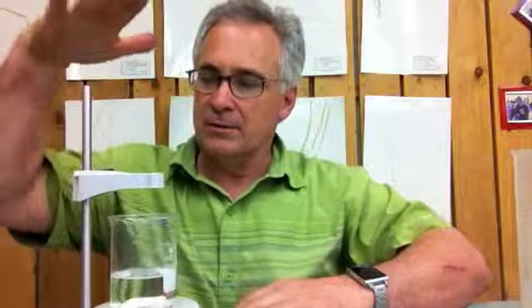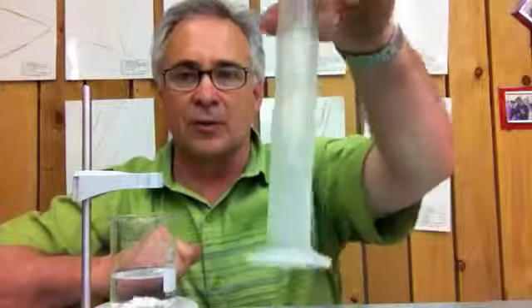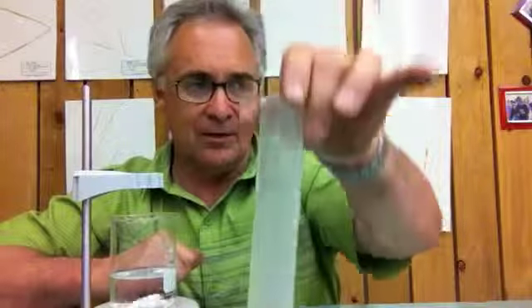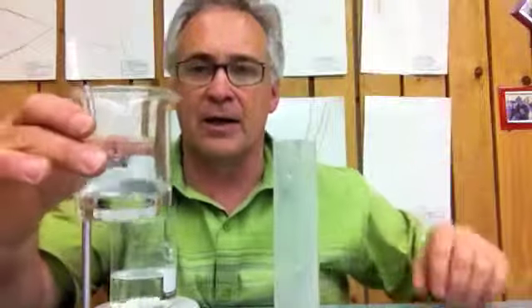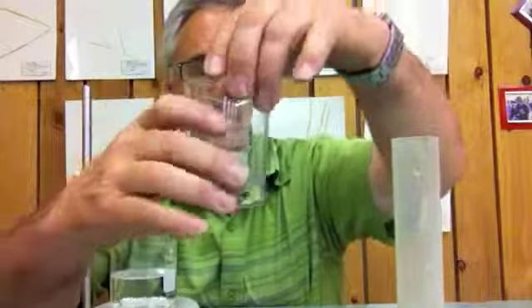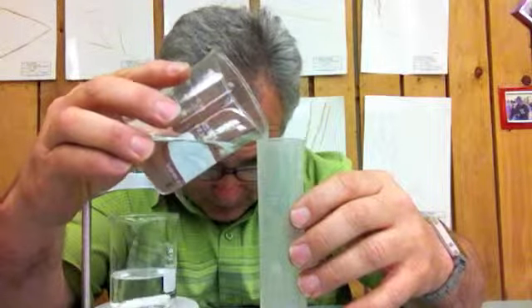Okay, now once you've got that done, so we need a ring stand, we need a beaker, we need 100 mLs of water. You're also going to need some vinegar, so we're going to be using our graduated cylinder again, and I just poured a little bit of vinegar right out of the 1 gallon container right here. This is the vinegar. And I'm just going to measure out 10 cc's or 10 mLs.